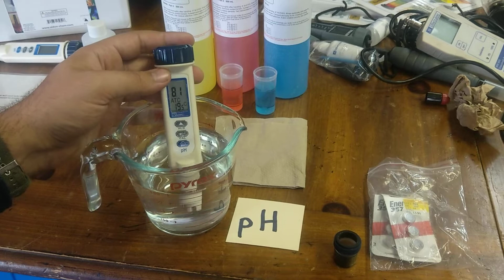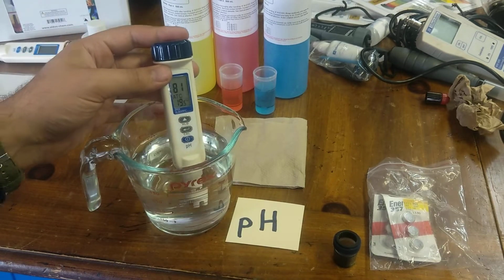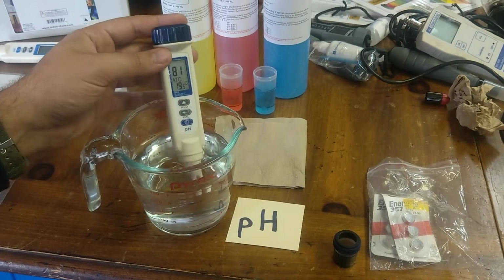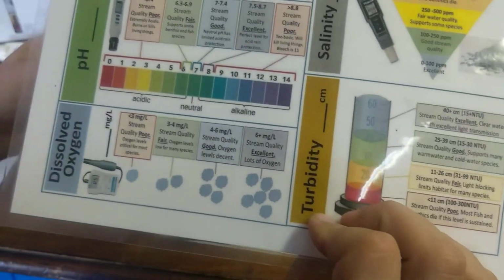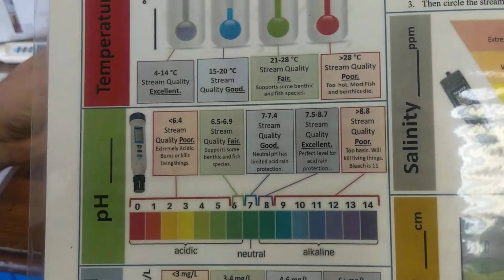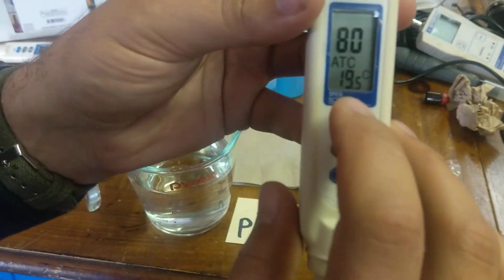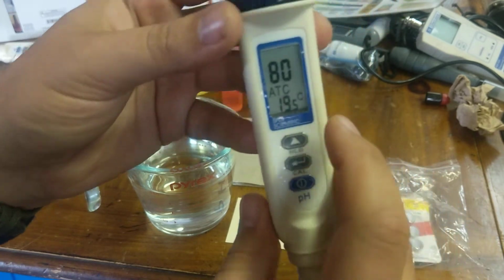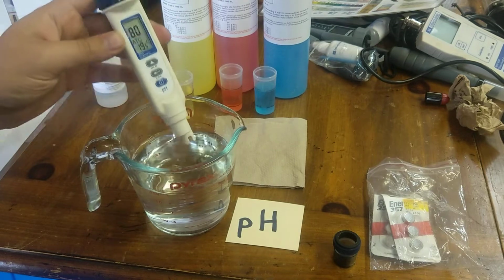In this case, again, you just wait for it to stabilize. It is stabilizing now. It's kind of going between 8.0, 8.1, which is good. And that is what you can have the students record on their sheet, which will tell you how good the pH is over here, which is in this case excellent for this water quality. This is just tap water that we're testing it on. You can also take a look. There is temperature readings here as well that you can use instead of a thermometer if you so wish.